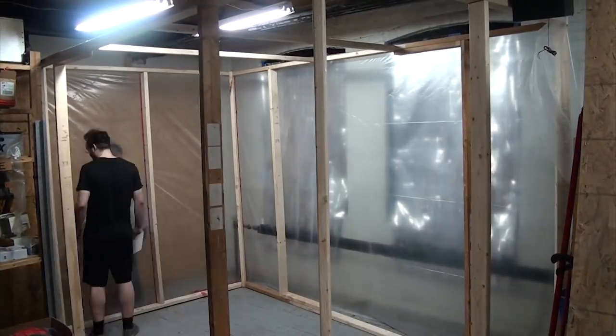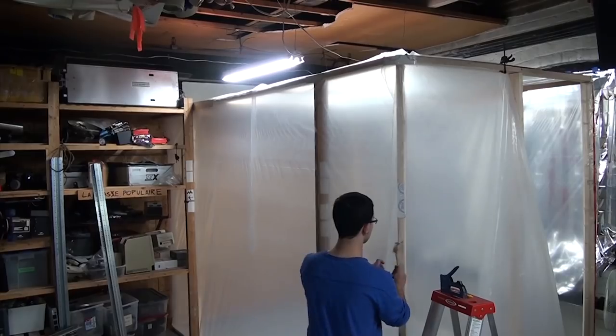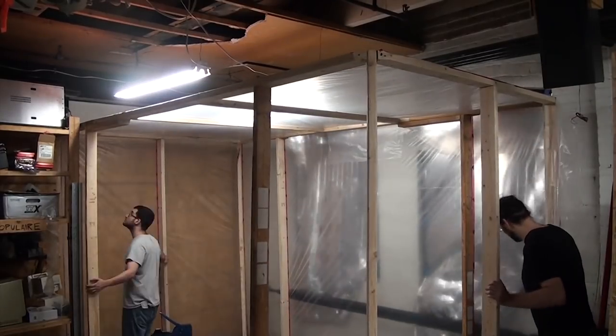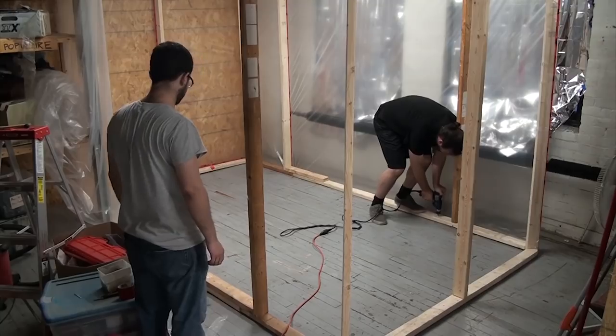Then once everything was stapled, all the staples and seams were covered with strong construction tape. Also, be sure to gently tap in any staples that don't make it all the way into the wood with a rubber hammer before taping. Once that was done, the frame was slid into place, then screwed into the floor and back wall to add some much-needed support and rigidity.